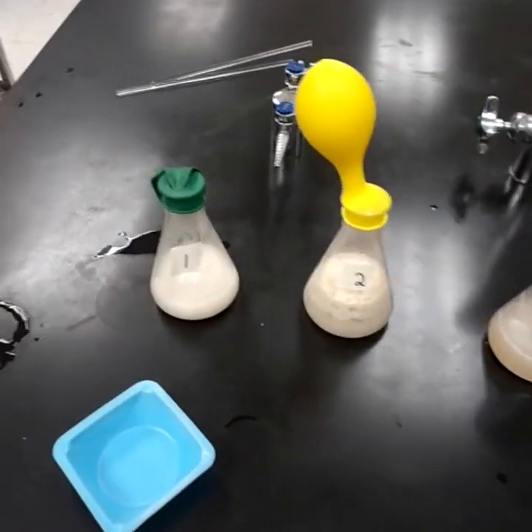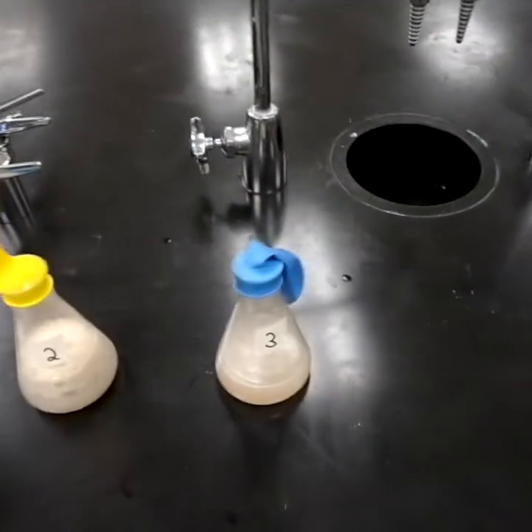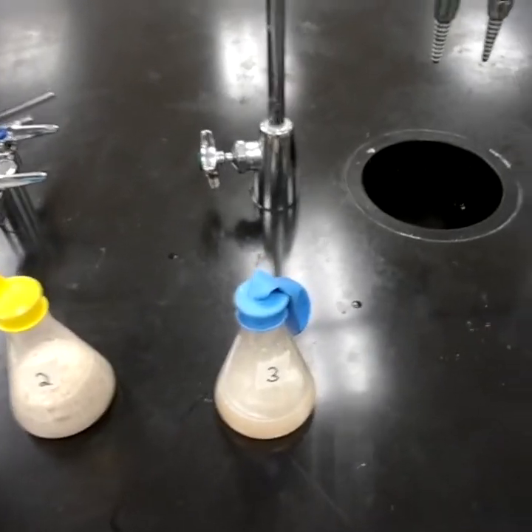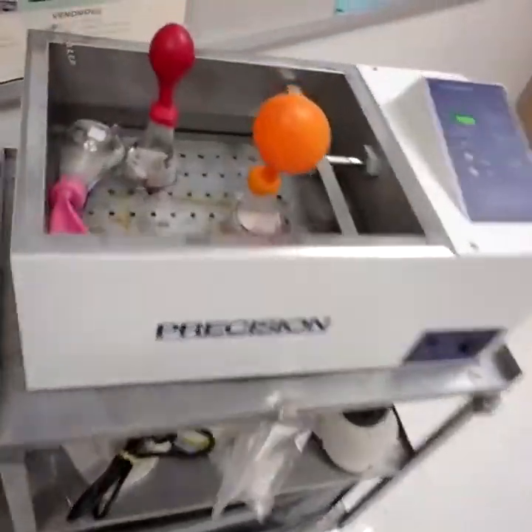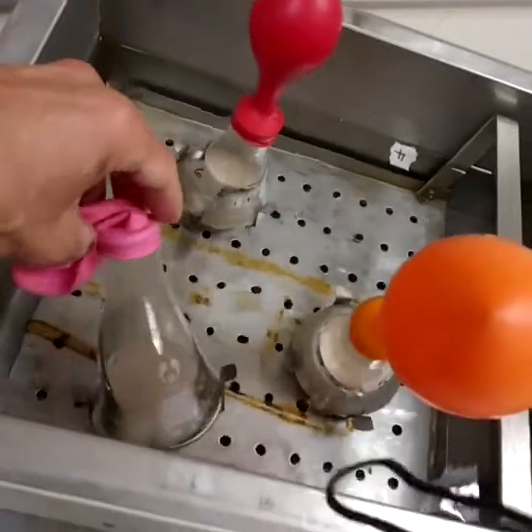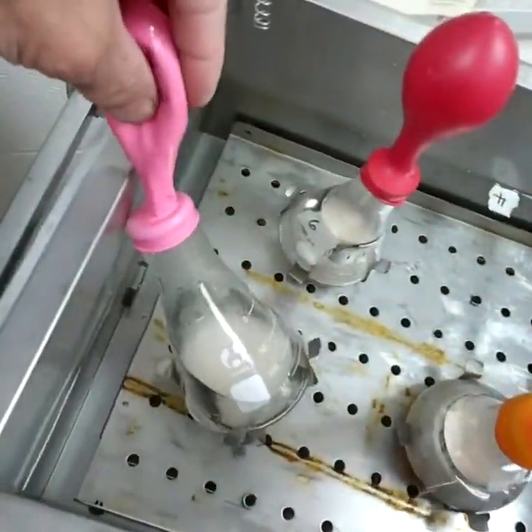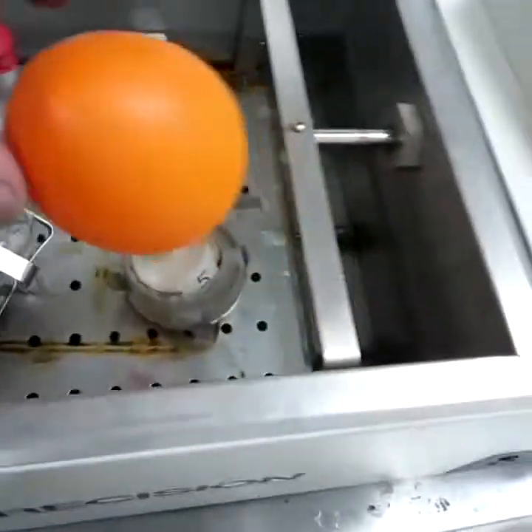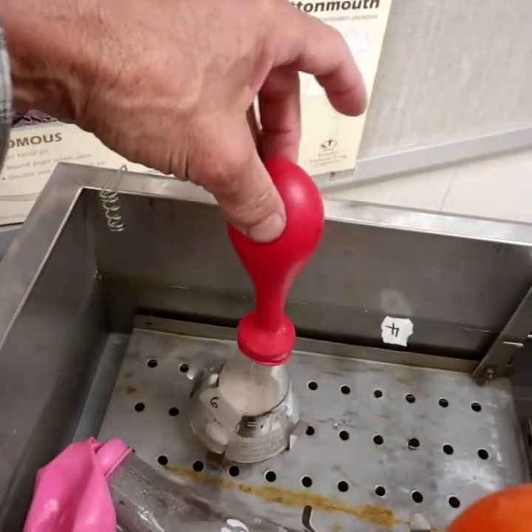All right. It's been 30 minutes now. That's number 1. No significant change. Number 2 is inflating a little bit. Number 3, didn't notice much difference there. Those are the room temperatures, flask 1, 2, and 3. Number 4, 5, and 6 are in the incubator. Number 4, not much of any change there. A little bit of gas in there, could be from expansion. That's number 5. It's looking pretty big. It's grown quite a lot. And that's number 6. It's getting some gas in there as well. Take a break for another 15. All righty.